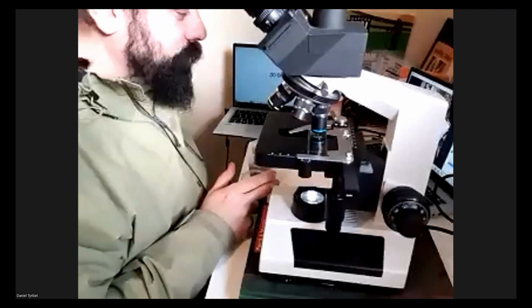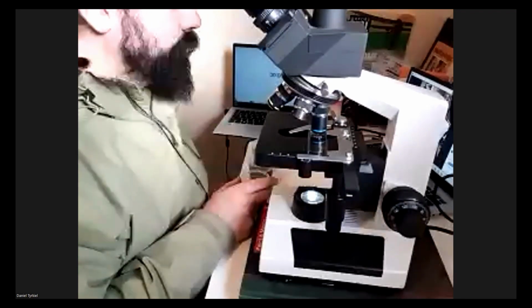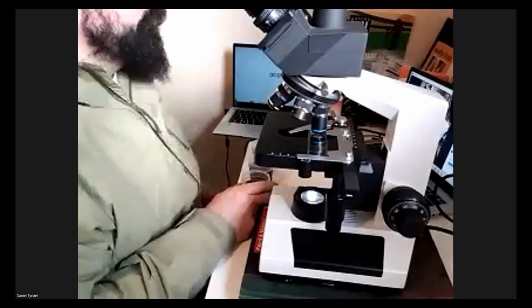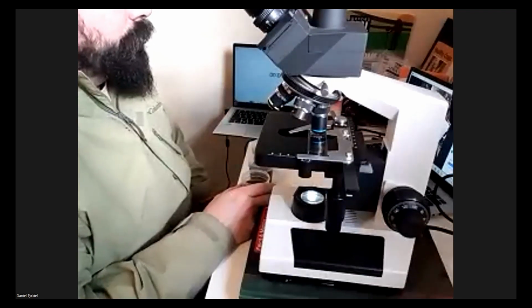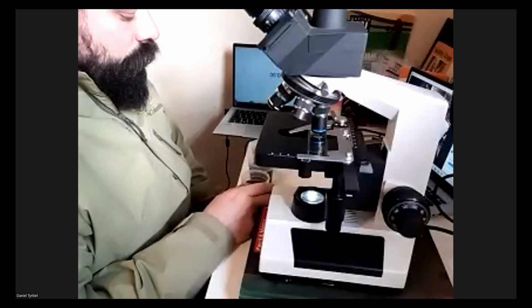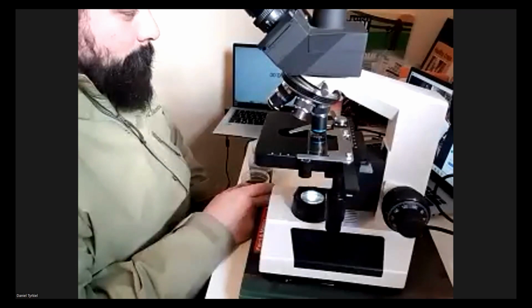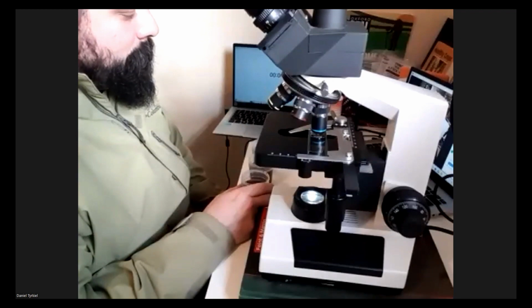So in general, we've got this tool to see what's in the soil, to see what's in the compost. Do you have enough microbes in the compost to start experimenting with by adding it to your seeds or adding it to your soil? We have used this tool to develop our compost and the product that we sell, as Adam said, the goop.